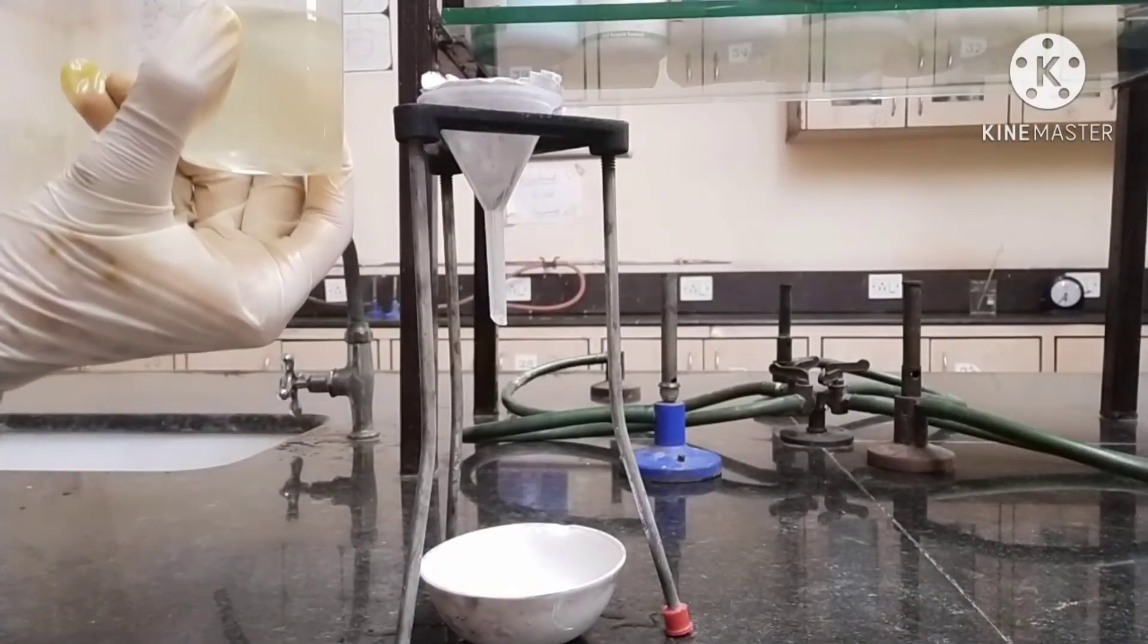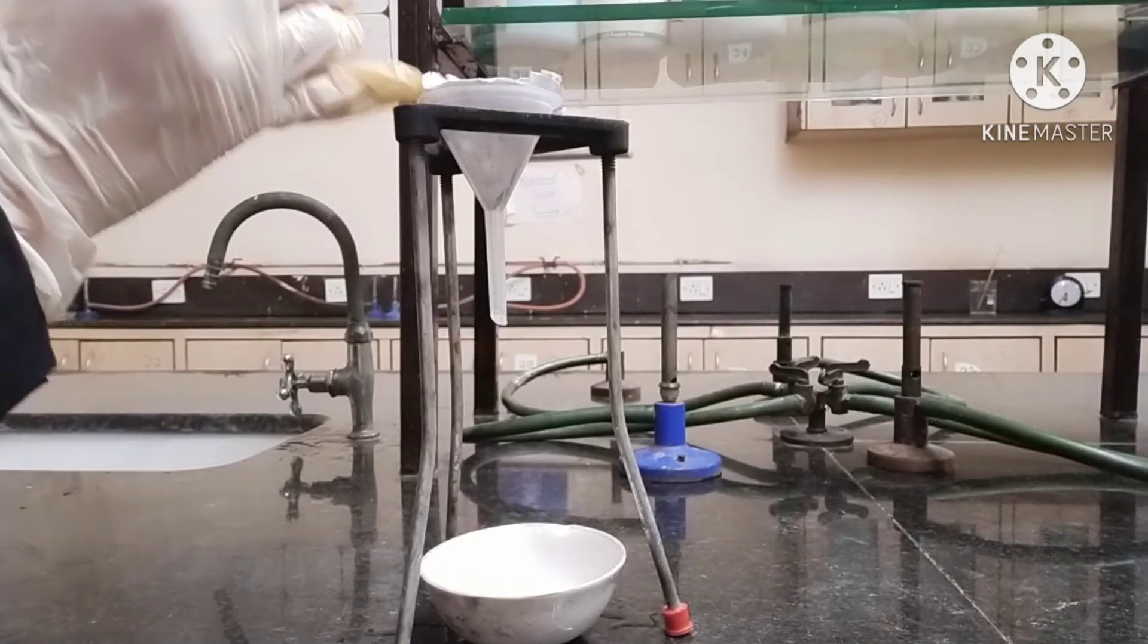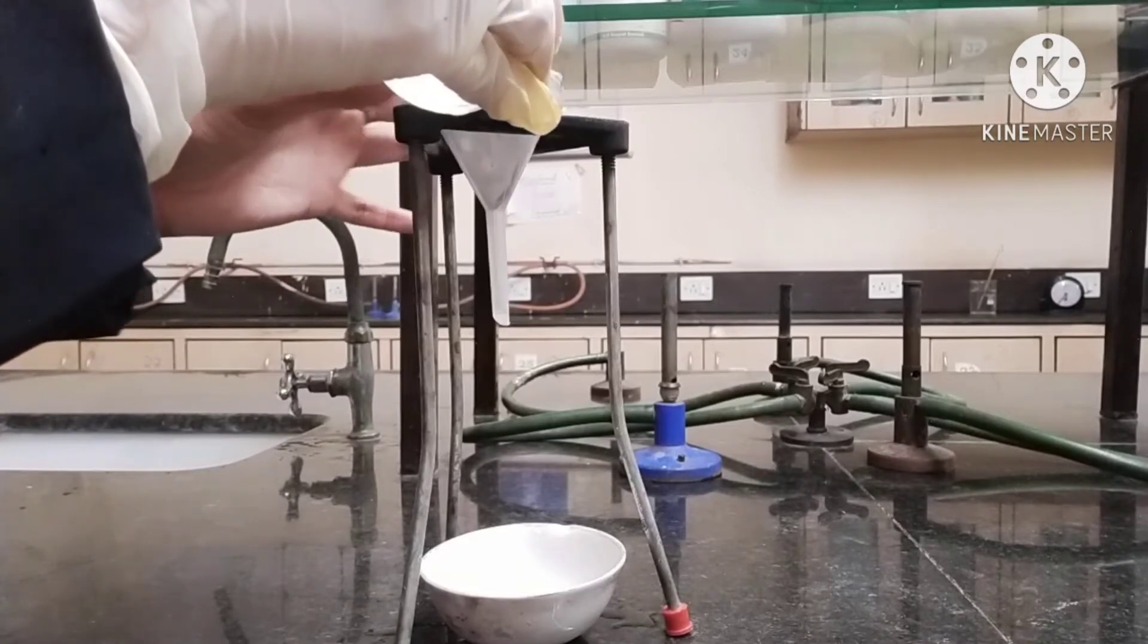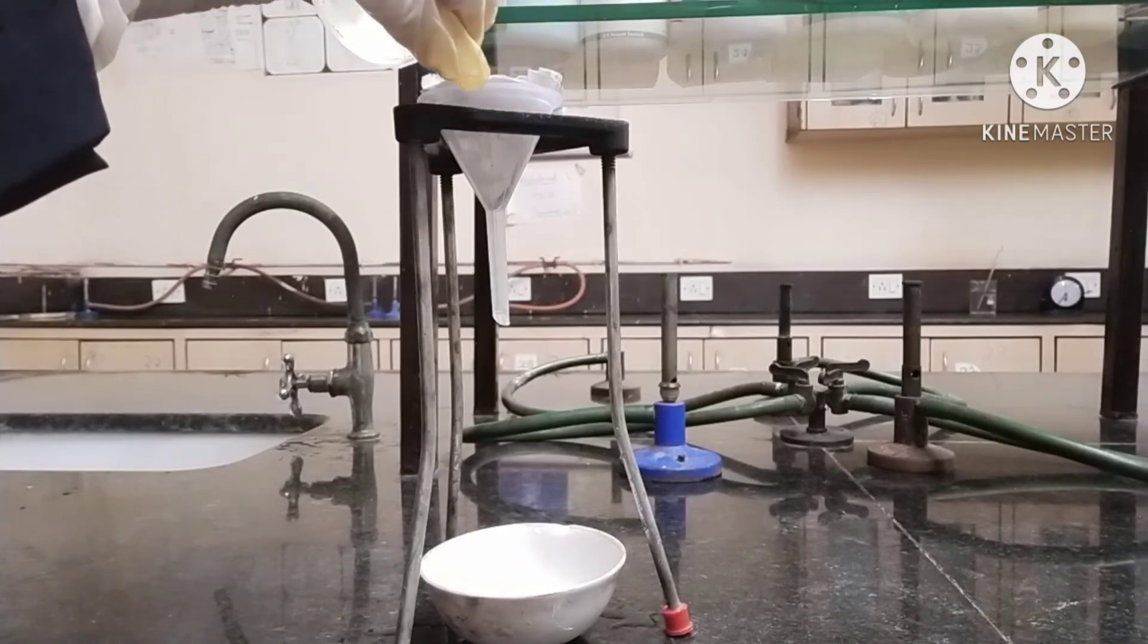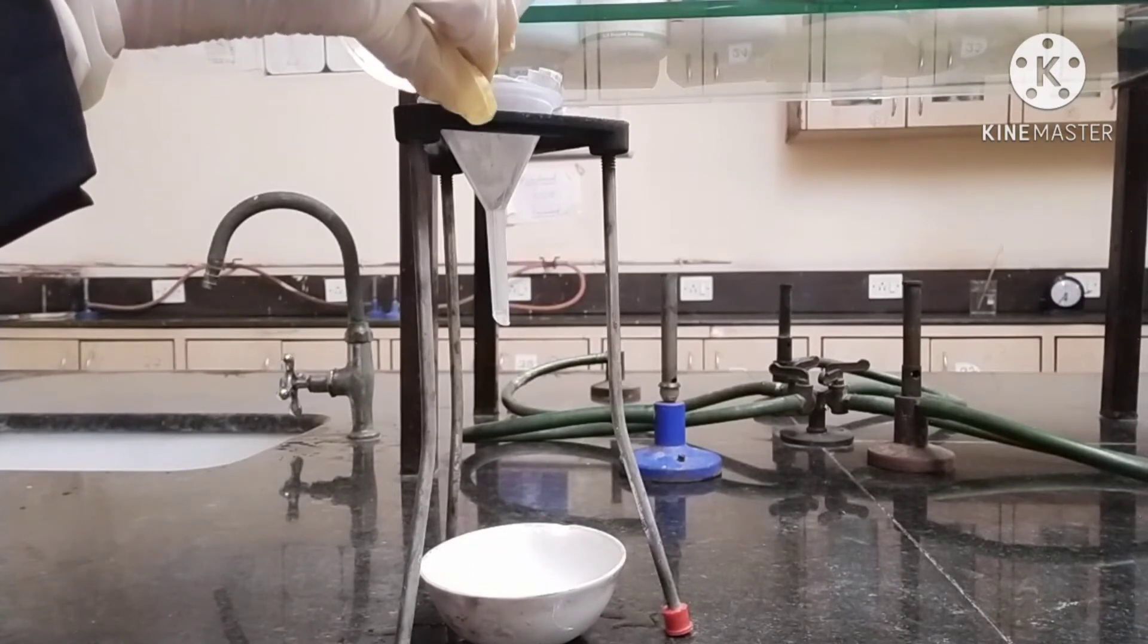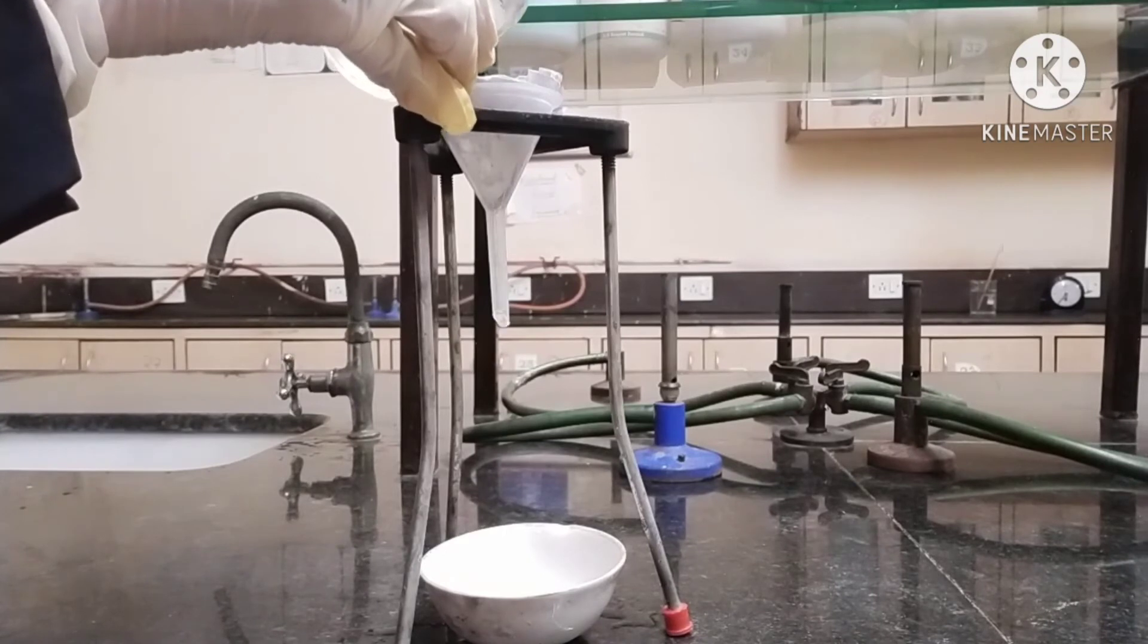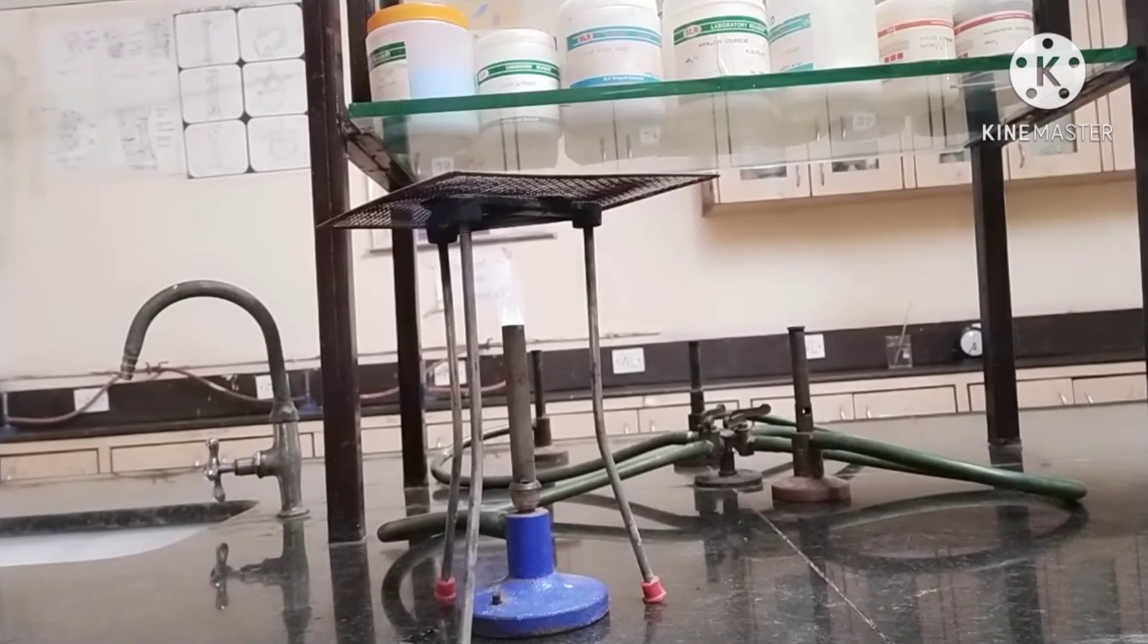After dissolution, filter this solution into a china dish with the help of a funnel and filter paper. Pour this solution like this.